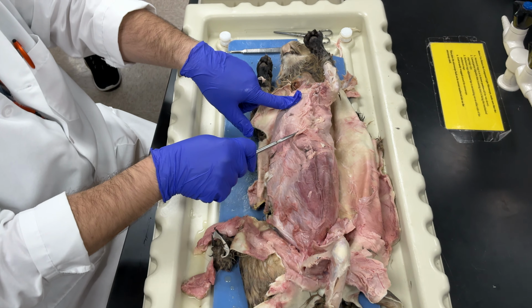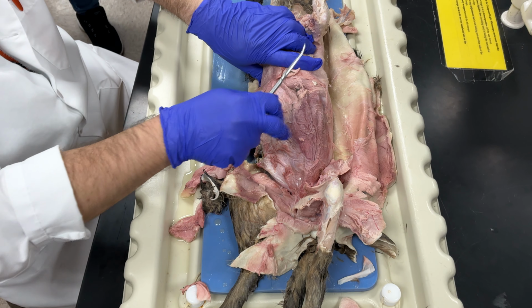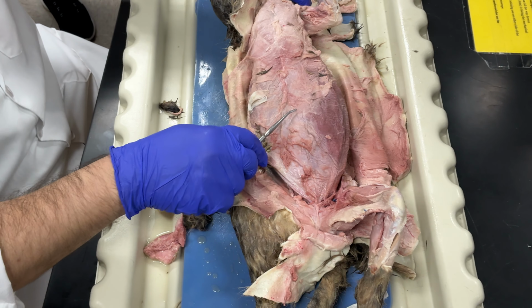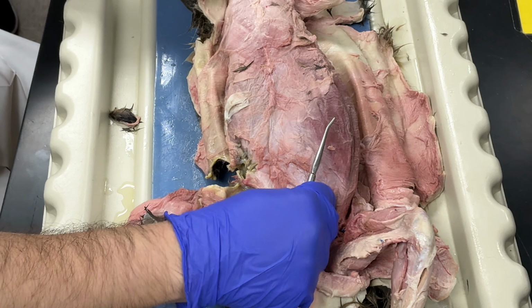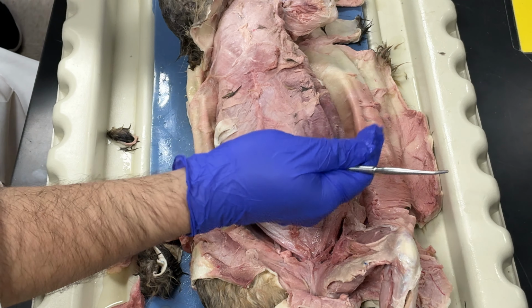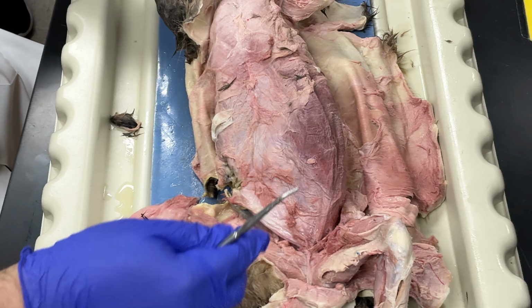And then if we look at the abdominal cavity here in the cat, this muscle on the side is the most external muscle of the abdomen. This is the external oblique. And then in the middle, covered by connective tissue, this is where we would find the rectus abdominis muscles, okay? So behind the external oblique, we would have one called the internal oblique, and behind that we would have the transversus abdominis muscle.